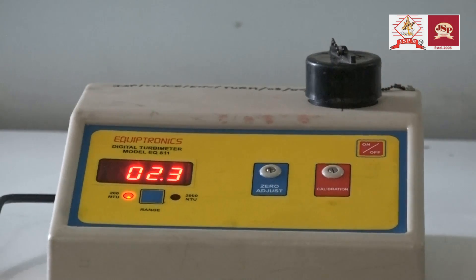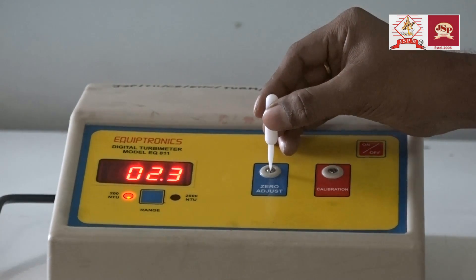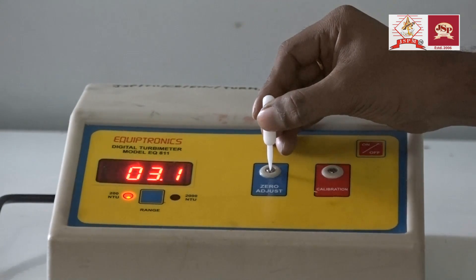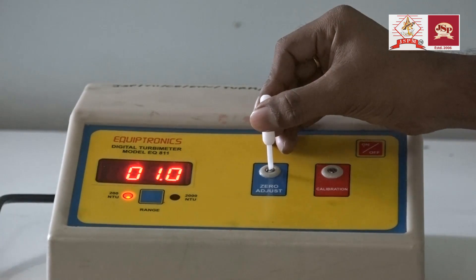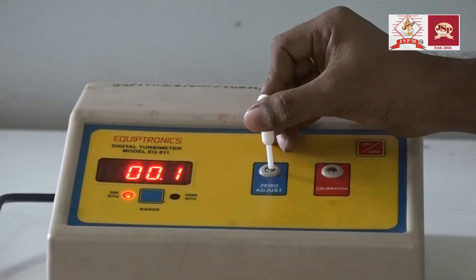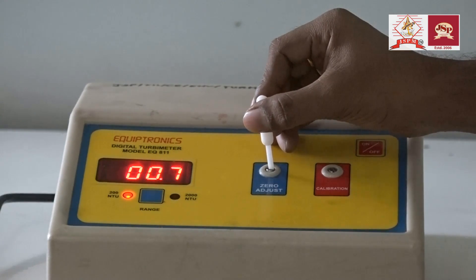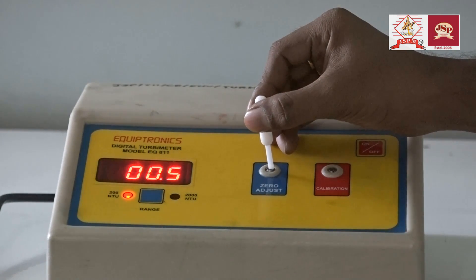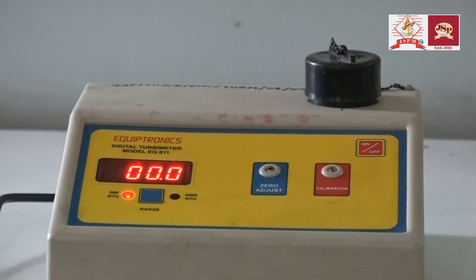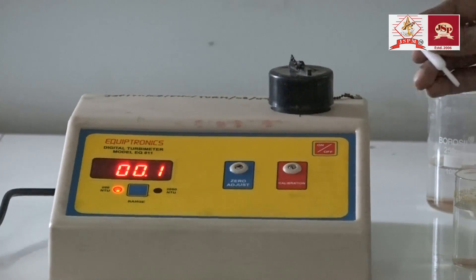Now I have to adjust it to zero. For adjustment, I will use the zero adjustment knob. Now the instrument is adjusted to zero. The instrument is now calibrated.